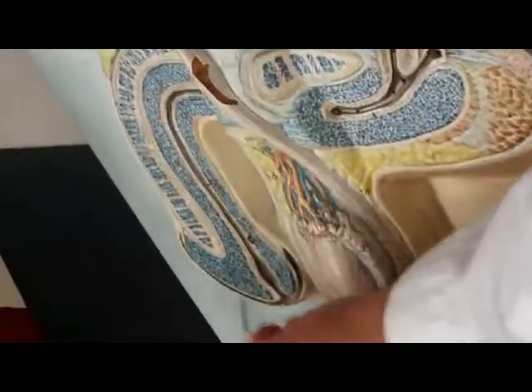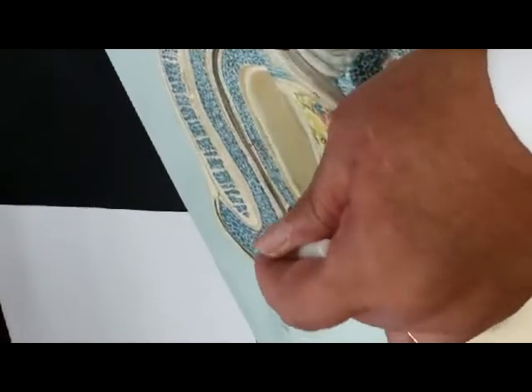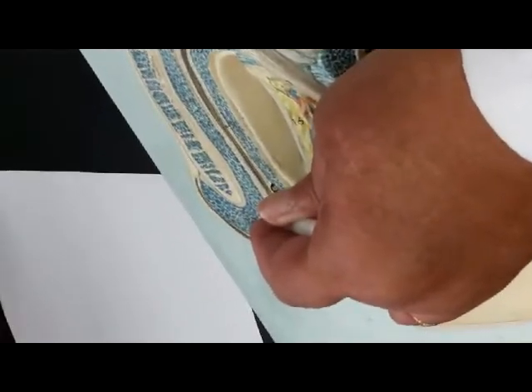Now let's talk about the penis. The covering on the outside is the prepuce or the foreskin that should be removed at day 8. At least that's the latest, day 8 or before the newborn male leaves the hospital. So the prepuce or the foreskin. Right here, the head of the penis is known as what? The glans penis.